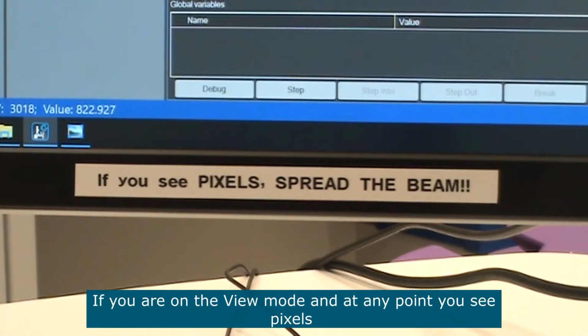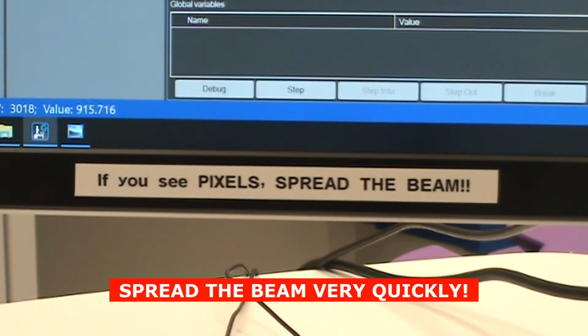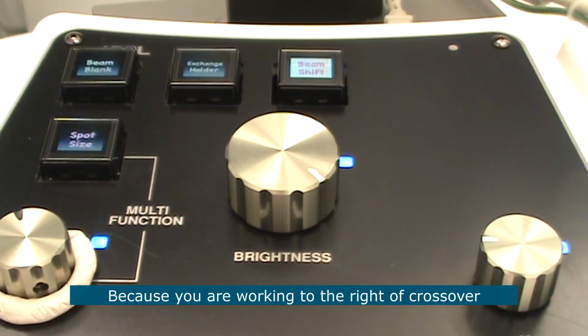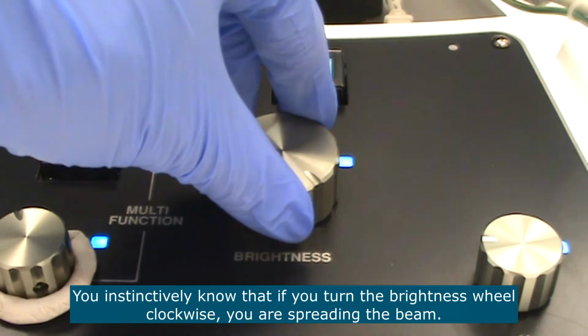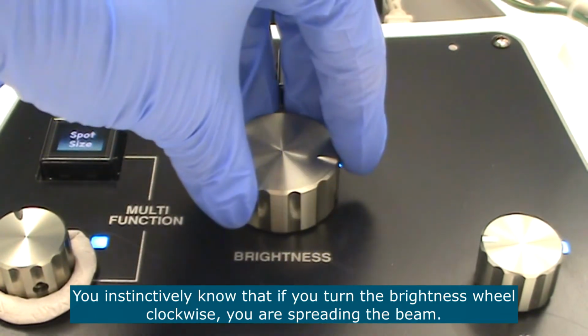If you are in the view mode and at any point you see pixels, very quickly spread the beam. The pixelated pattern means that your camera is being overexposed, and that's very dangerous for the camera. Because you are working to the right of crossover, you instinctively know that if you turn the brightness button clockwise, you are spreading the beam.